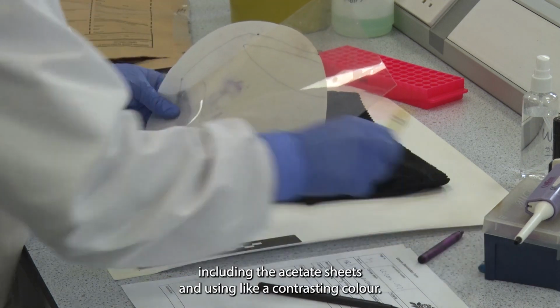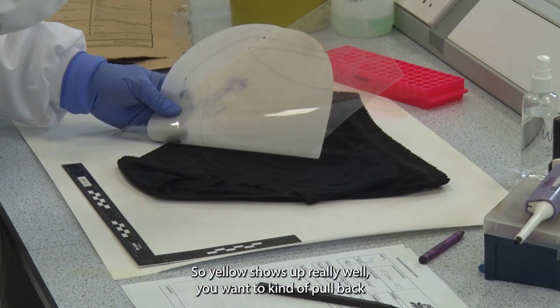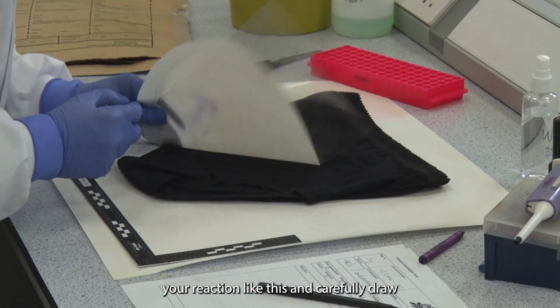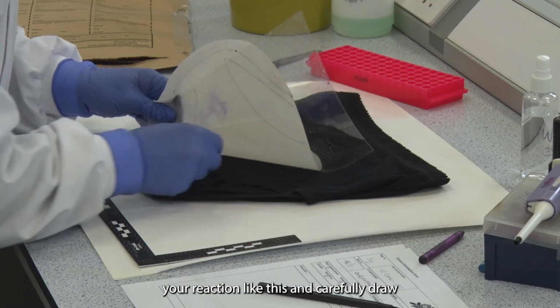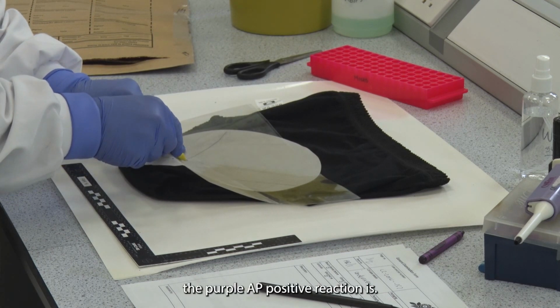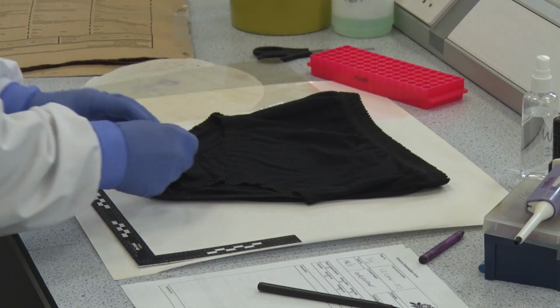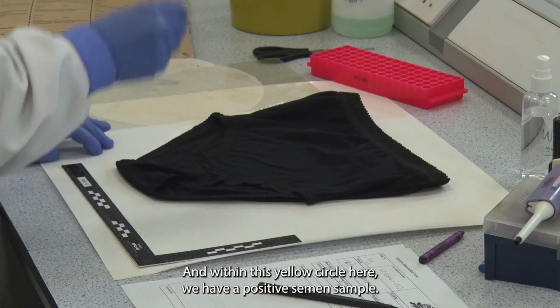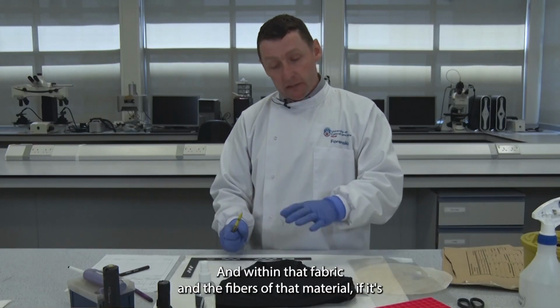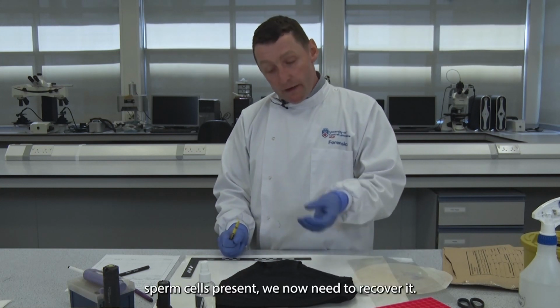including the acetate sheet, and using a contrasting colour, so this is a black fabric, so yellow shows up really well. You want to pull back your reaction like this and carefully draw around where the purple AP positive reaction is. So afterwards you can take this to place it to one side for now, and within this yellow circle here we have a positive semen sample, and within that fabric and the fibres of that material, if sperm cells are present, we now need to recover it.